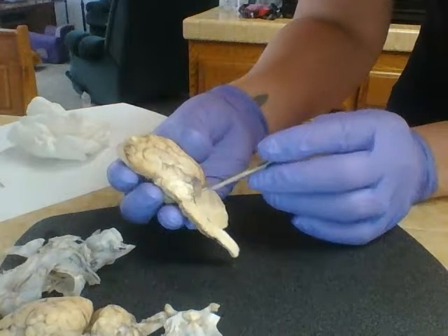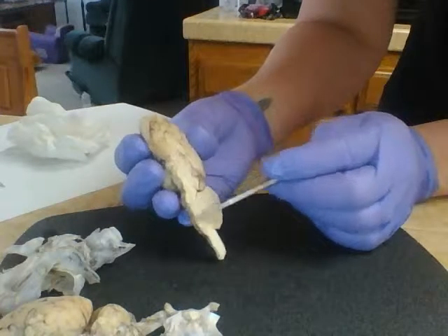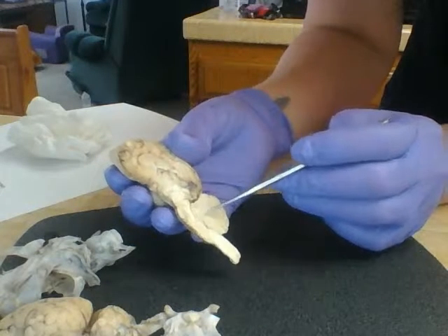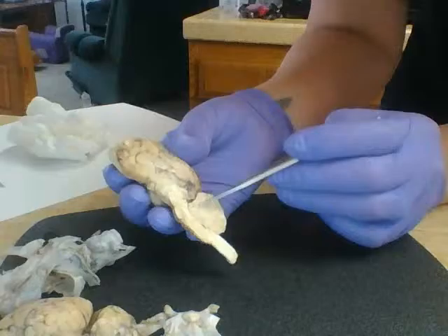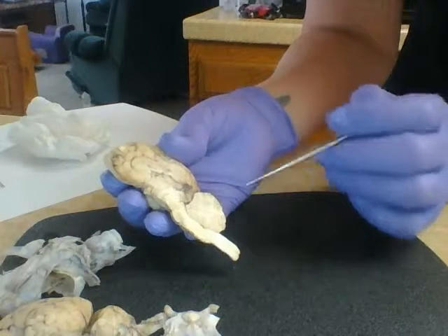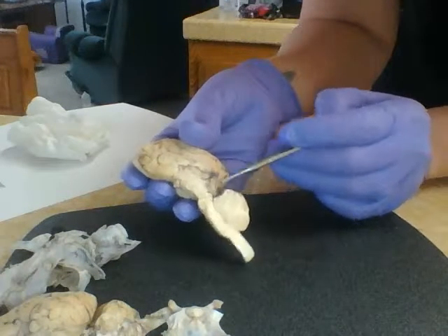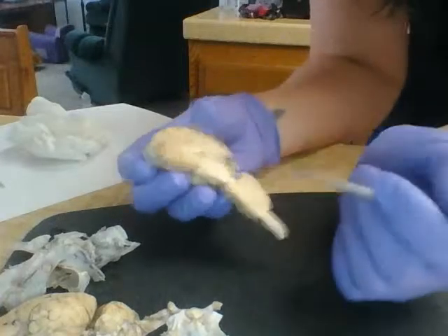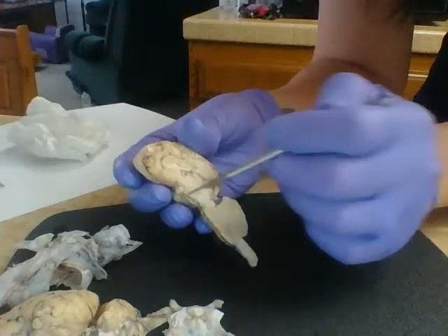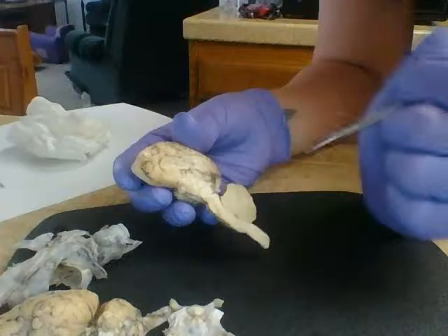The pons kind of bulges out off of here off the thalamus. The medulla oblongata comes down around this way, and here we have our cerebellum. Now we can see the arbor vitae within the cerebellum, which is basically the white matter. So we can see gray matter here, and then the white matter that branches out in between, and that's that arbor vitae. And that corpora quadrigemina we can see here that branches down from that. Now again, the fourth ventricle, the ventricles we can't obviously see because they run through the areas. That runs through the midbrain, the pons, and the medulla oblongata. So that runs all down through that area.